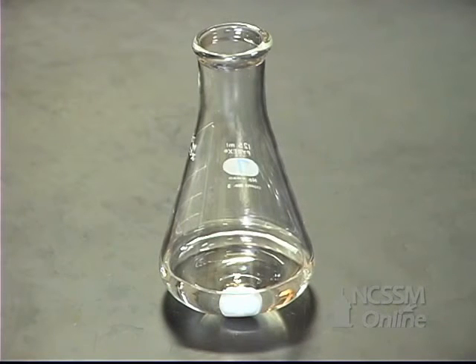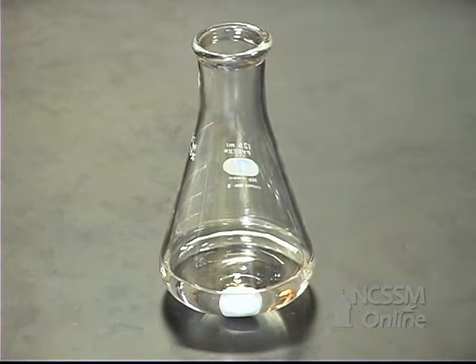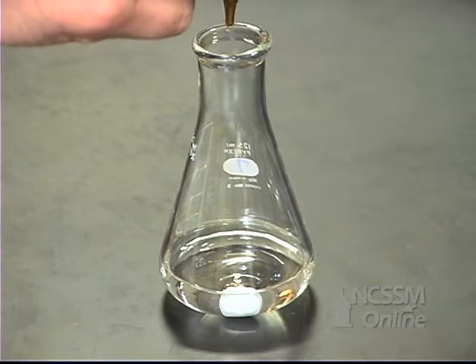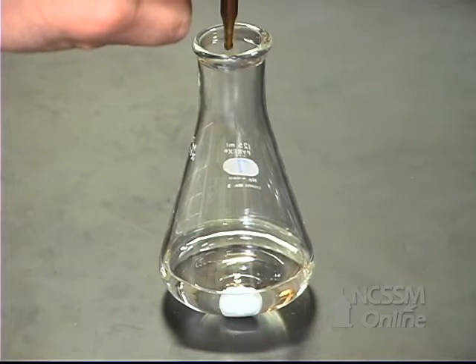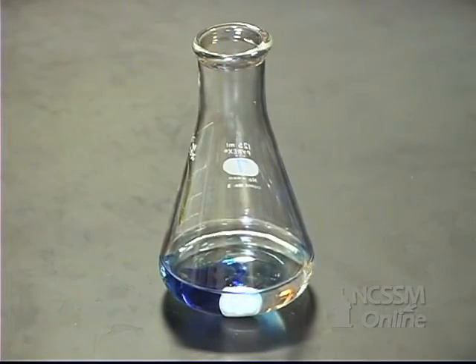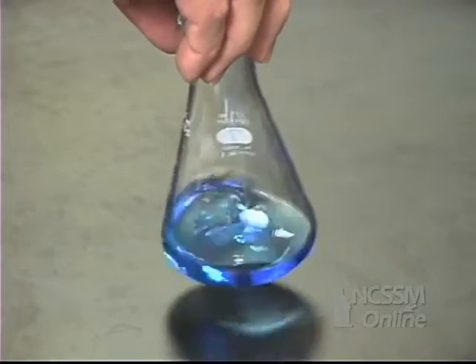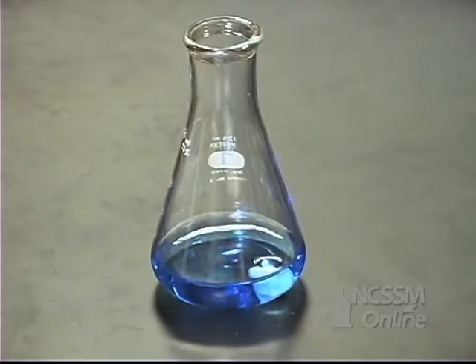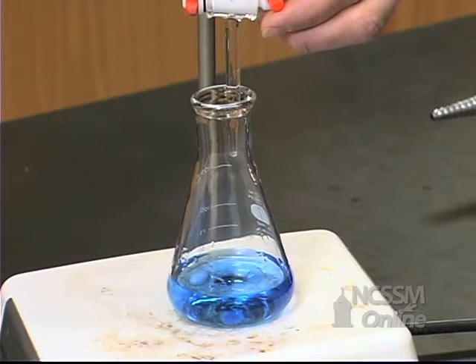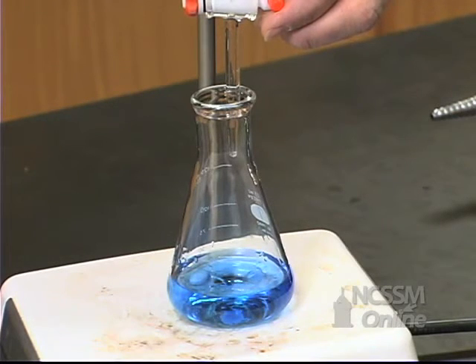We're going to add a few drops of bromothymol blue indicator. Bromothymol blue is an acid-base indicator that is blue in basic solution and yellow in acidic solution. We're going to titrate the saturated solution of calcium hydroxide with a standardized solution of HCl.